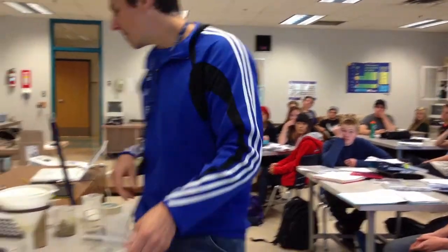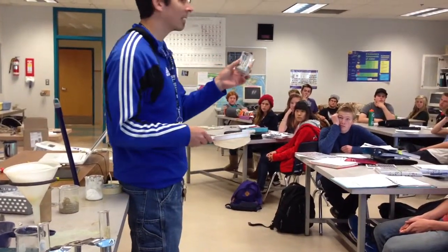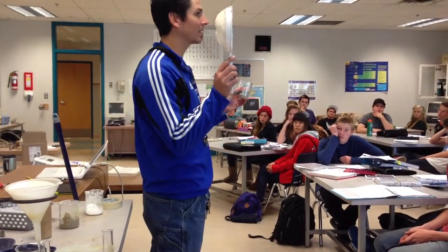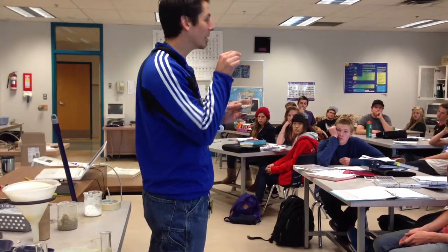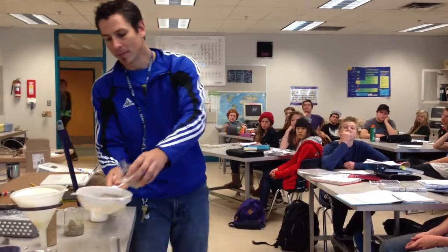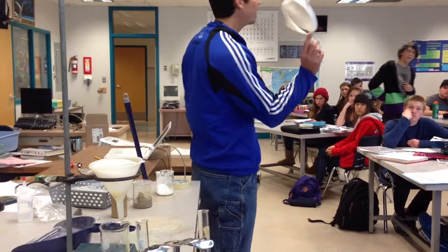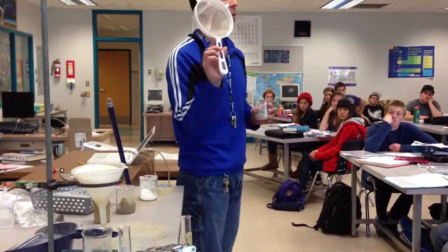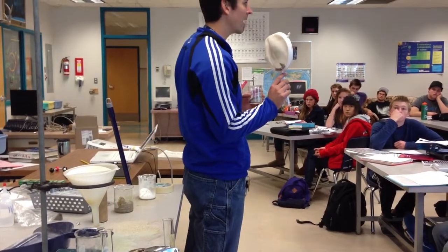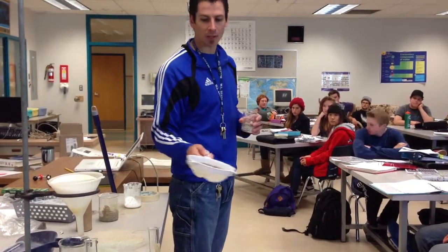Okay? Now, there are other types of hand separation as well. Here, I've got a mixture of little pebbles, so gravel, and some sand. And I'm going to use this device to separate them. It really is the equivalent of me going in with tweezers and pulling them out, but this is a faster version of it. And so when I pour it on the sieve and I shake, the sand goes through, the pebbles get left behind. Okay? What is the property that was different between the sand and the pebbles that allowed me to do that? The size. Okay, so large things got trapped, small things went through.